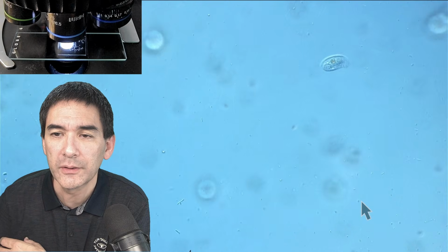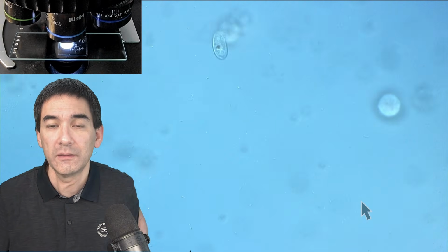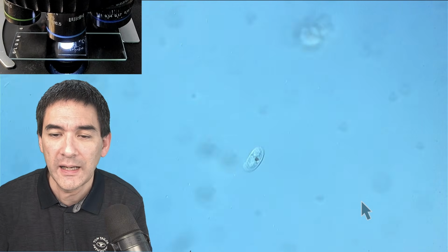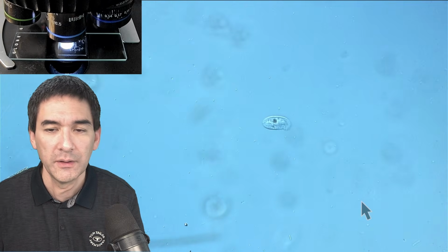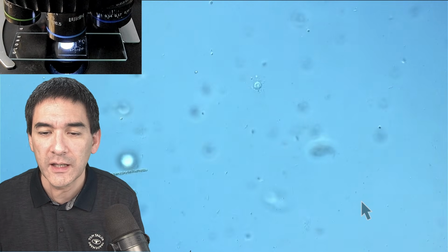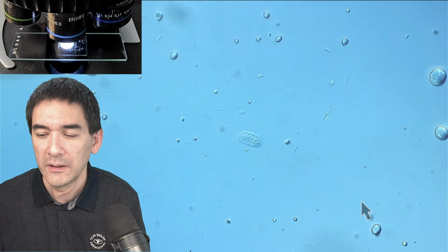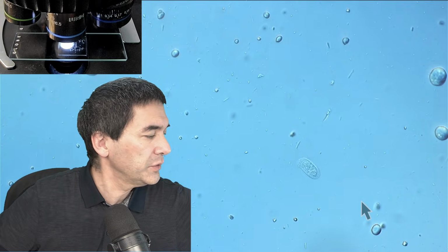Blurry, blurry, better. Yeah, and what I also sometimes, as I said before, recommend is if you give it some chlorella algae to feed, maybe they're actually going to turn green. Maybe that's also something that I can do in an upcoming live stream. You just give them something to feed. As a matter of fact, I can actually do this today as well. And you know what? I'm just going to do that now. Okay, look at what I've got here.